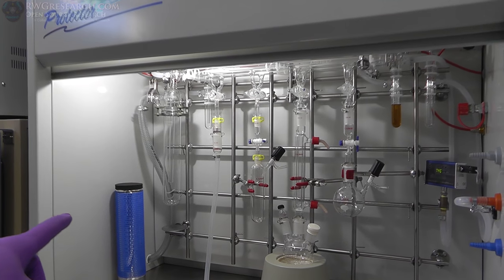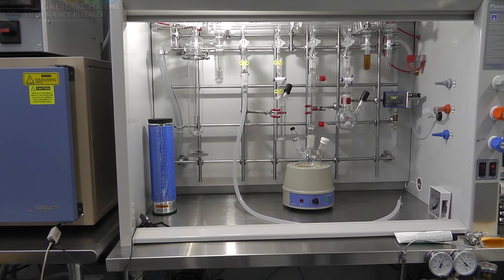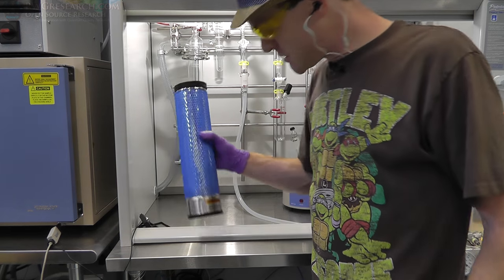Now let's talk about that thing right there. Alright, so let's talk about this. What is this?